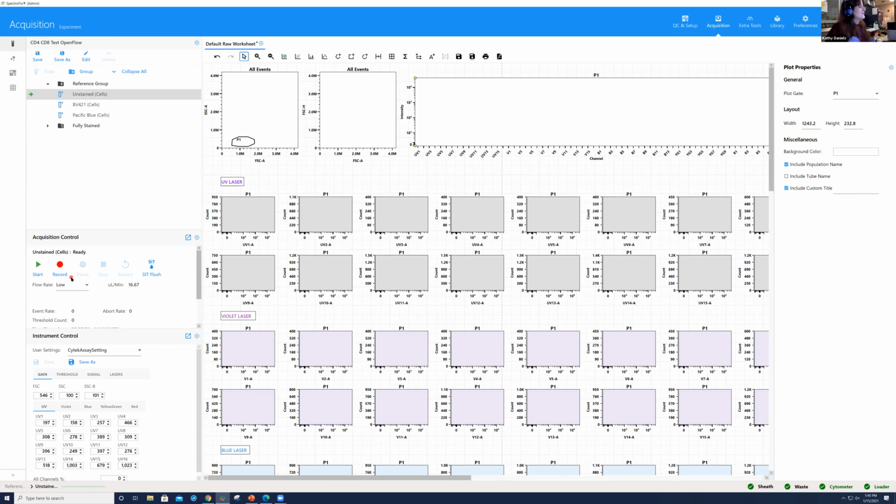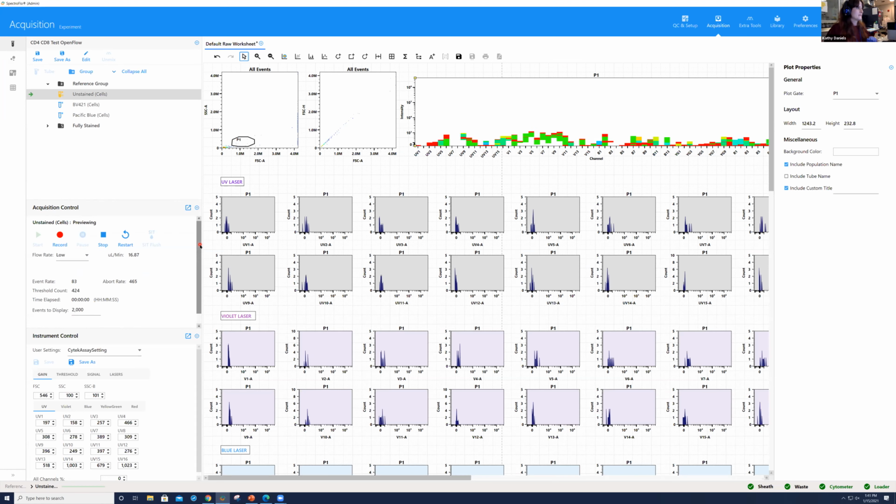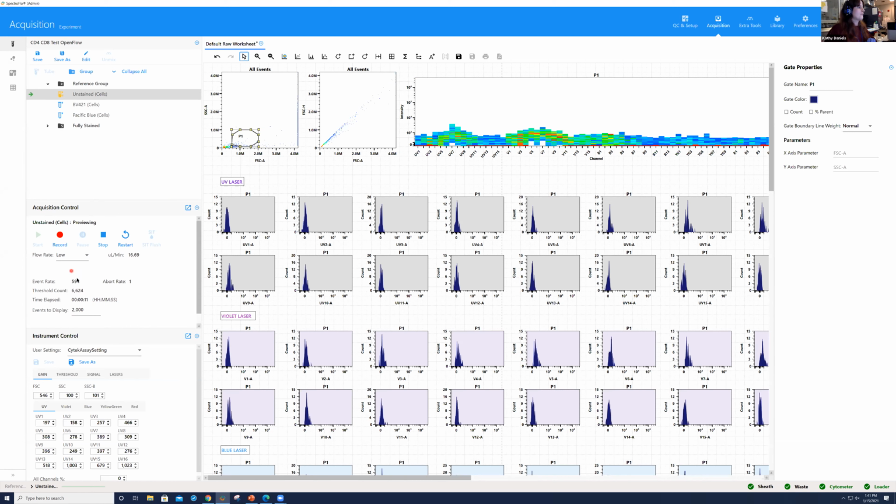All right. So then what we're going to do now is select start. And when we select start, we're going to see our events popping up in just a little bit. It's important to note that unless you deselect it, it automatically takes up a starting boost of sample to get the sample coming through pretty quickly. Now, what you see here is I have about 600 events per second coming through, but I'm not seeing what looks like cells on the plot. The cells we're working with today are leukocytes, which should have a traditional lymphocyte, monocyte, and a small granulocyte population. And I'm not seeing that.